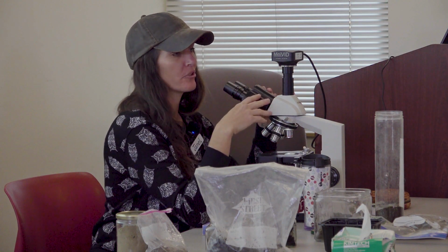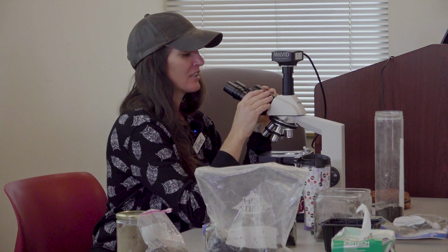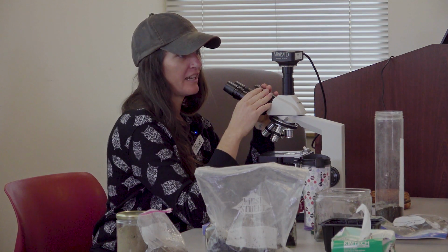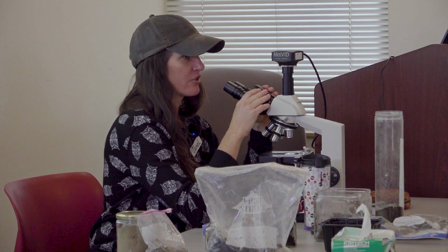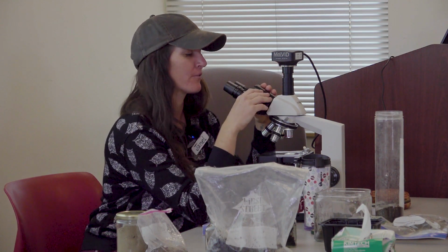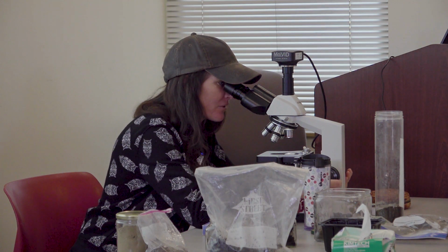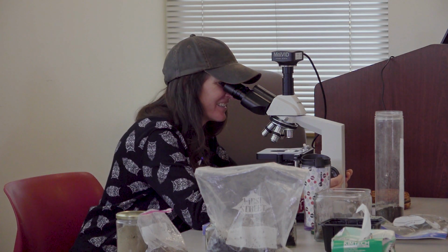Typically, so I teach community microscope classes in my community up in Paradise. And it's usually my policy that to keep it very unbiased, we don't say whose sample it is we're looking at. Often also because people bring samples from local businesses, and it's never my intention to put anyone on blast, and I certainly don't want to make anyone here feel insecure about their compost either. So you're welcome to announce it if you see me using your sample, but otherwise I'm not going to say anything if you don't. I don't care. You can totally share. Can you announce, sir? Yeah. Go ahead and announce.